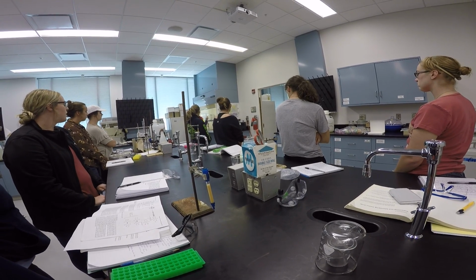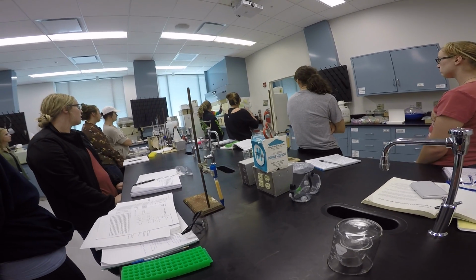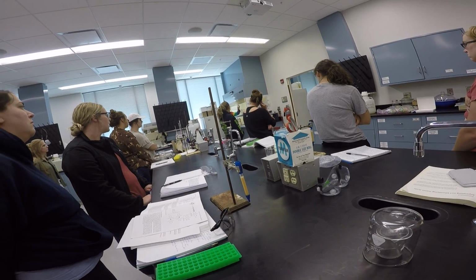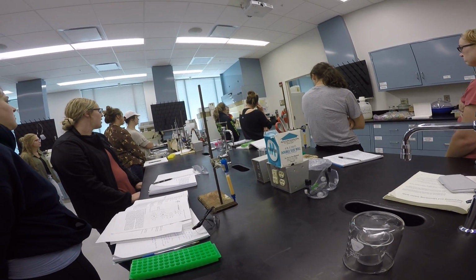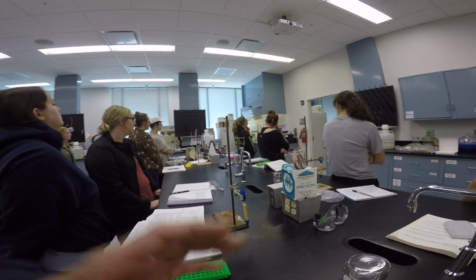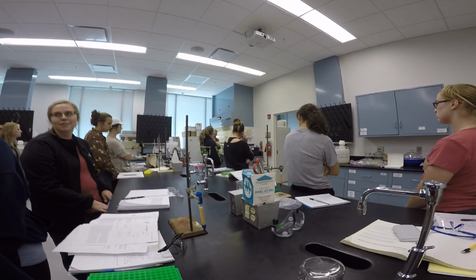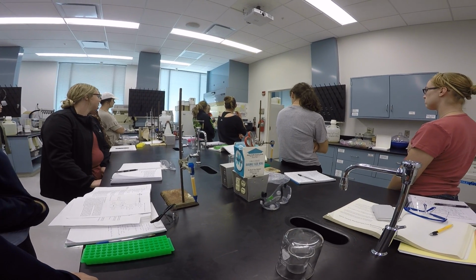But we just said that this reacts with any protein, any free amino acid, and your hand's got them all over. So unless you want to have a purple hand by the end of the day, wear gloves and hold it with this. You don't have to get it totally soaked. You should just get a nice clean spray, but don't get it soaking so it's sopping and falling apart.